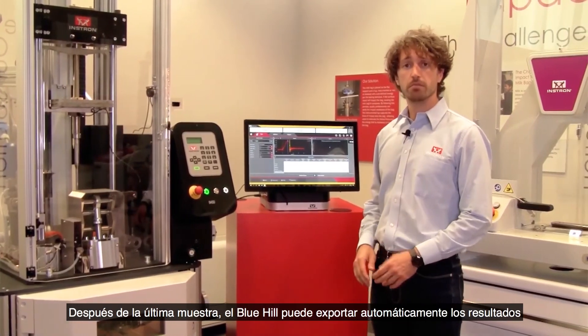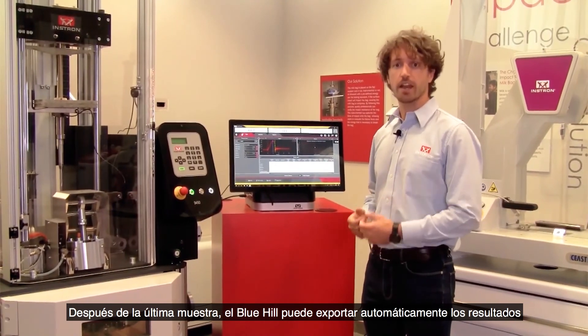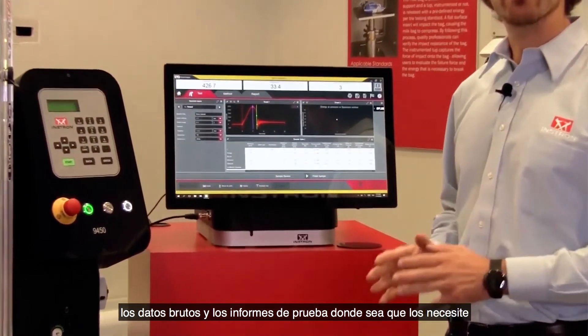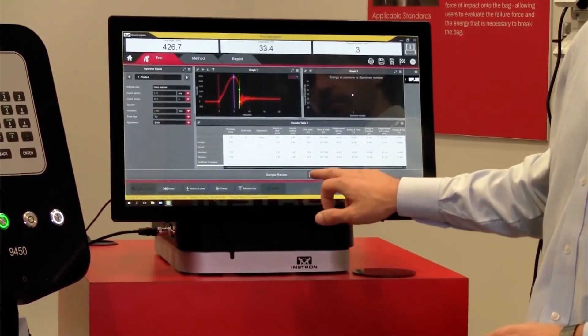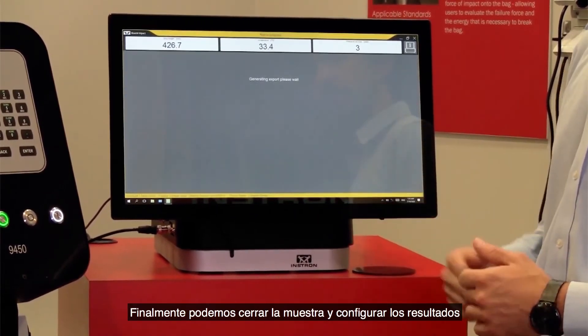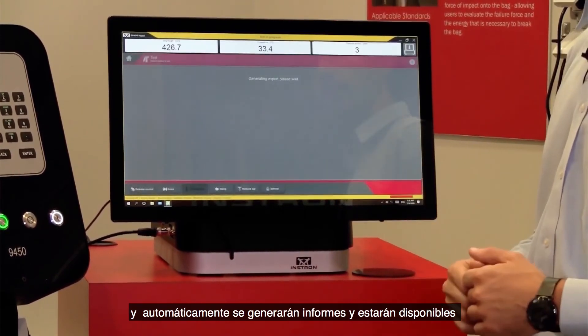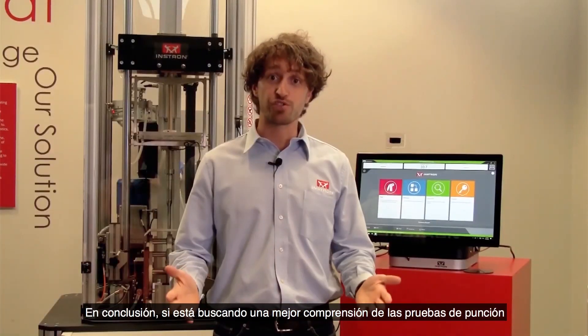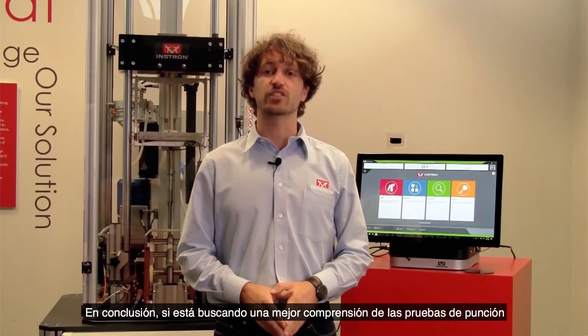After the last specimen, Bluehill Impact can automatically export results, raw data, and test reports wherever you need them to be. We can finally close the sample and set results, and reports will be automatically generated and made available. In conclusion, if you are looking for a better understanding of puncture tests and all the best practices to perform impact tests and be 100% productive, feel free to contact us. We will be happy to talk with you.